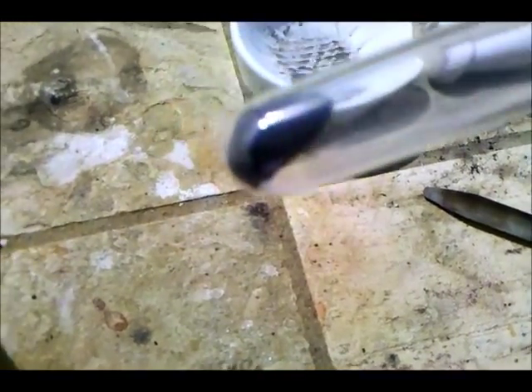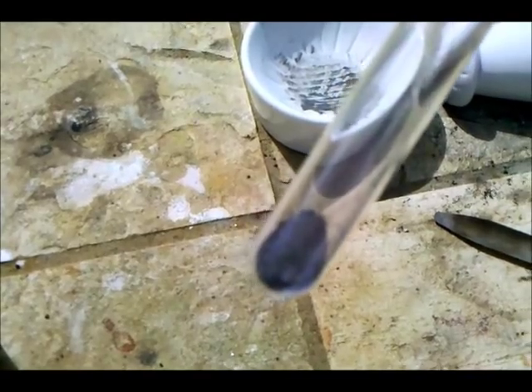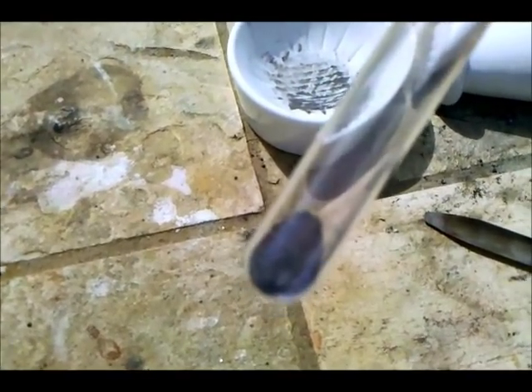So here I've got some silicon that I made in my last video that I've ground up into a really fine powder. And I'm going to be adding some sodium hydroxide beads in there and then putting a little bit of water on it. The reaction consumes water as well.